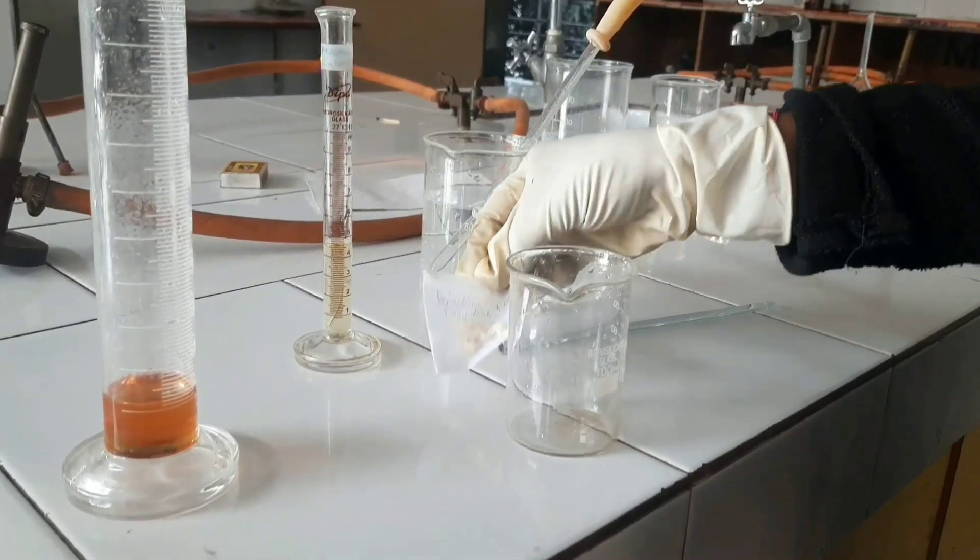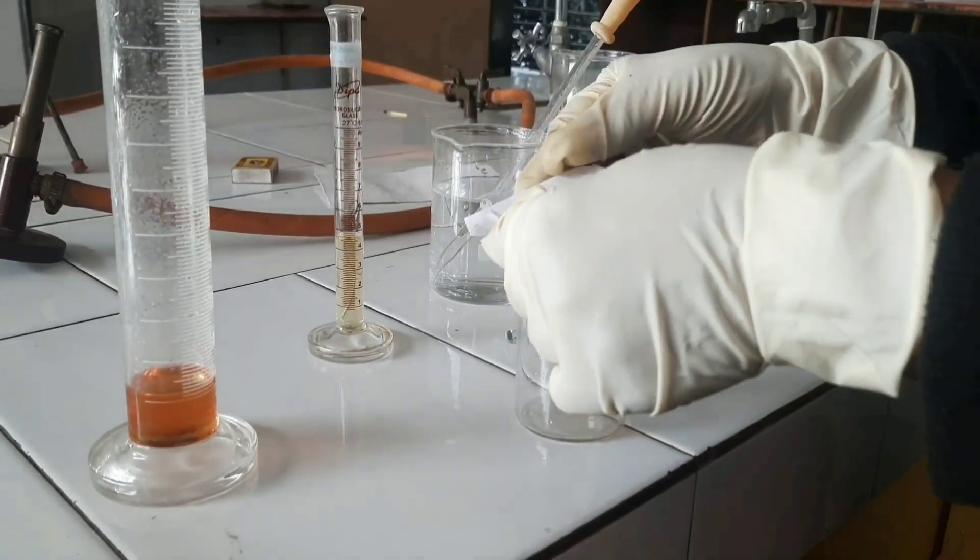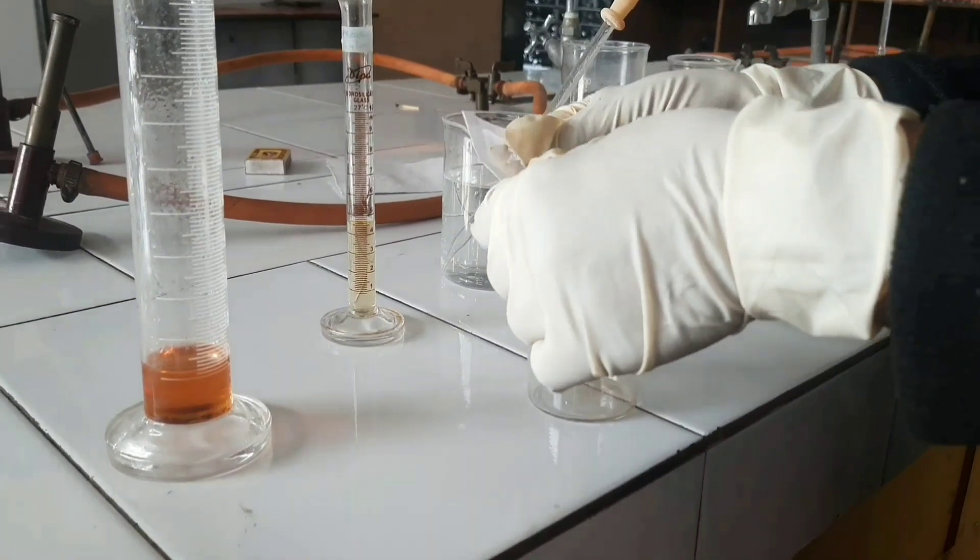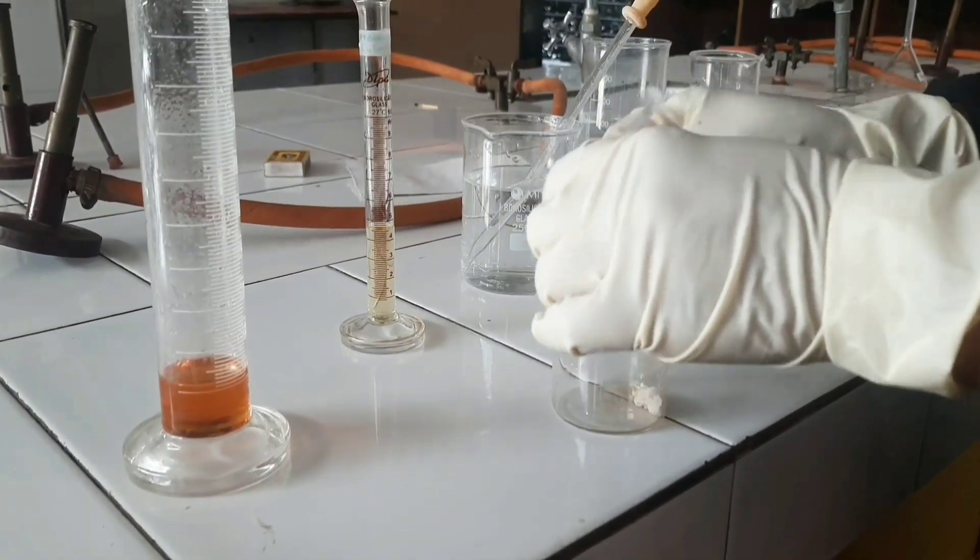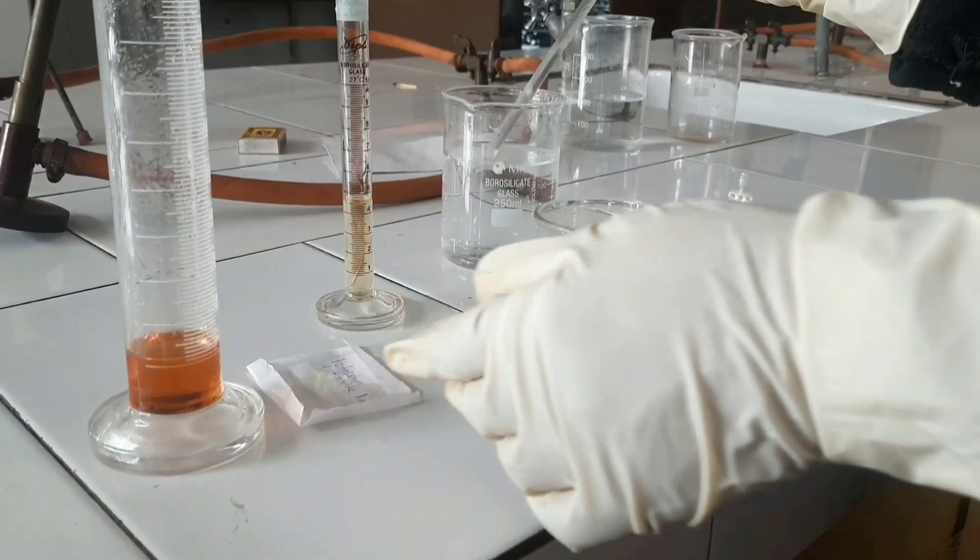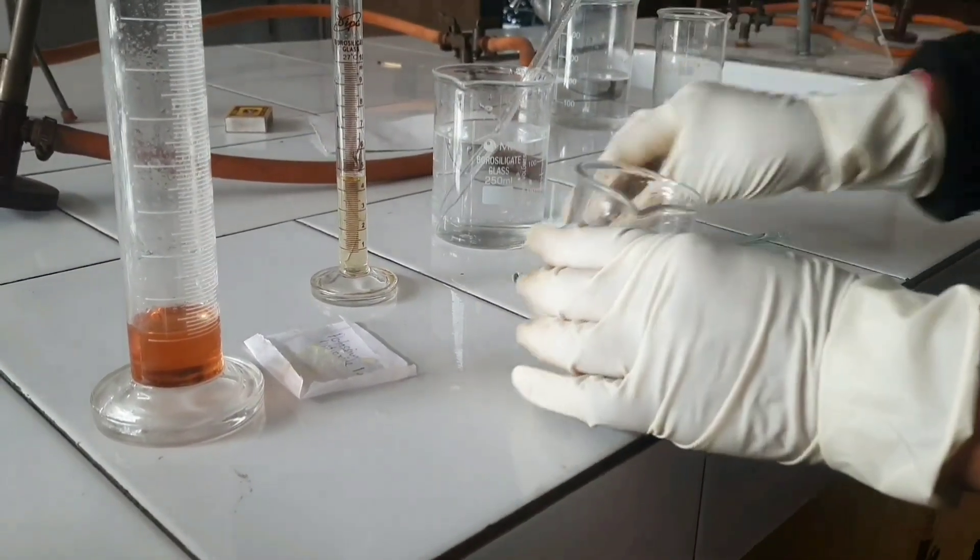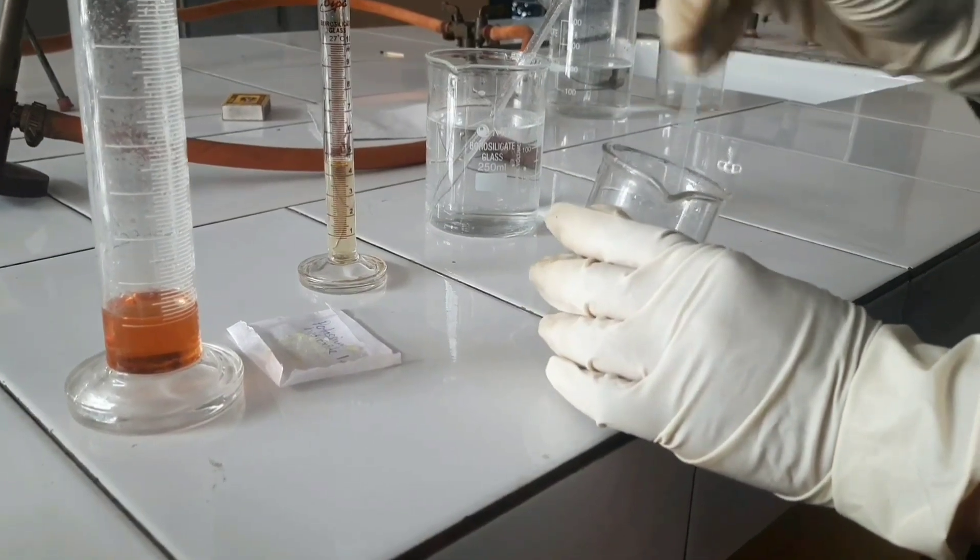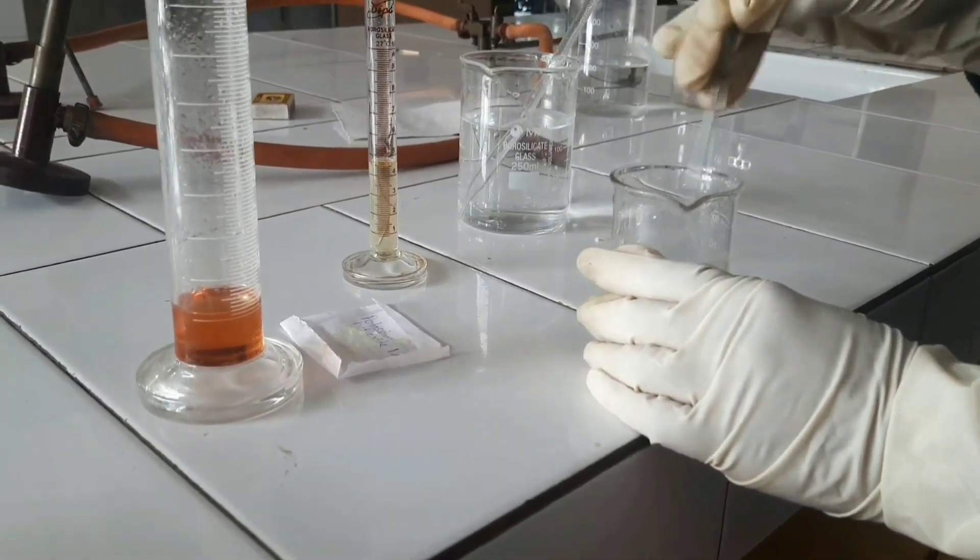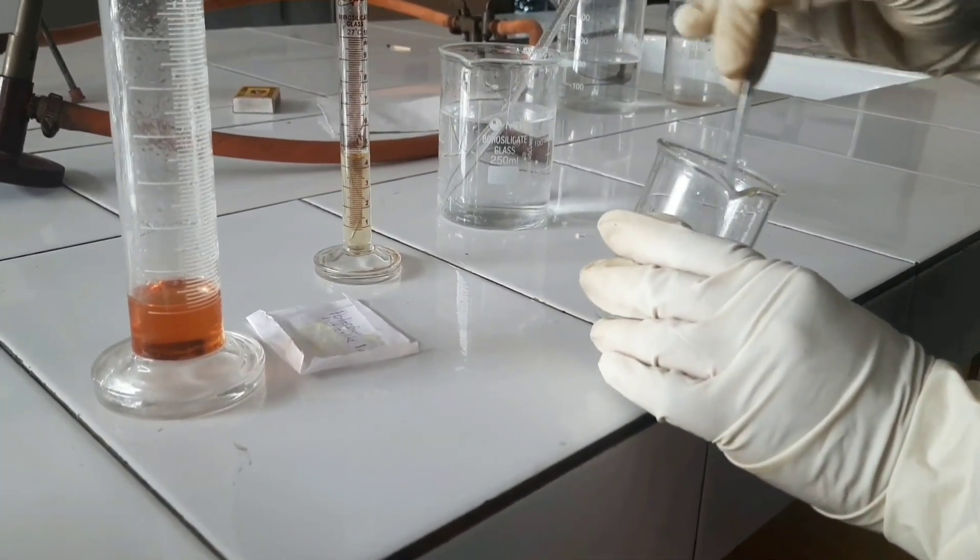Procedure: Dissolve potassium hydroxide in purified water. Add potassium hydroxide in a beaker, add purified water in some quantity, and stir it until the particles are completely dissolved.